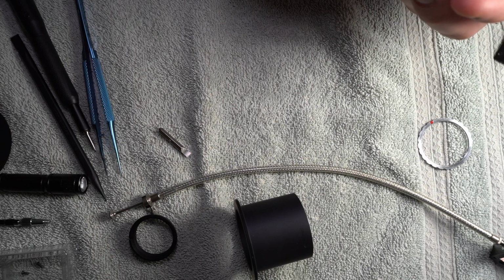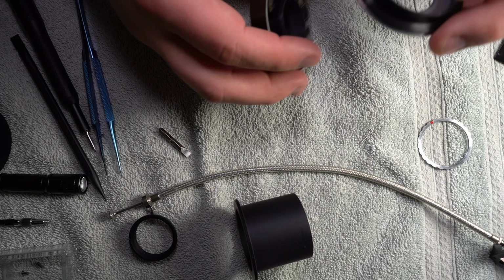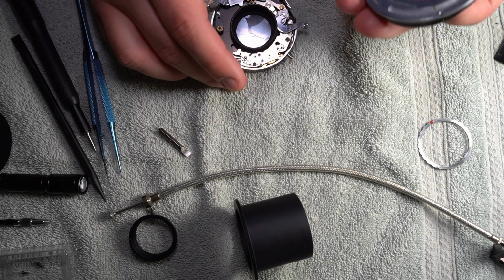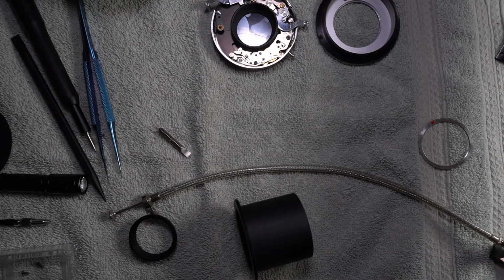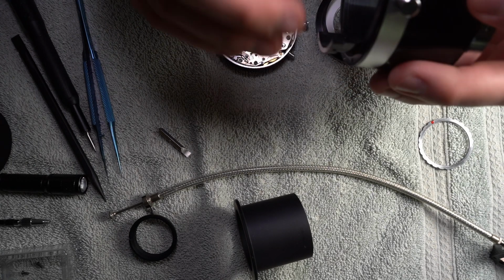Okay, this was really stupid on my part for not paying attention to how this went on and off. You were wanting to move before. What's wrong now? Shoot. I'm trying to figure out how this thing all clips together. It's on time.